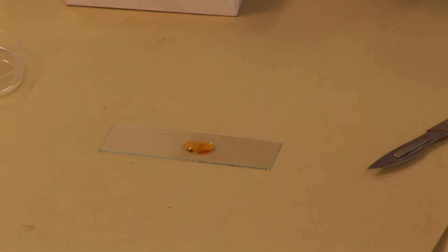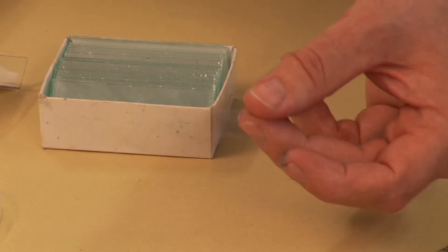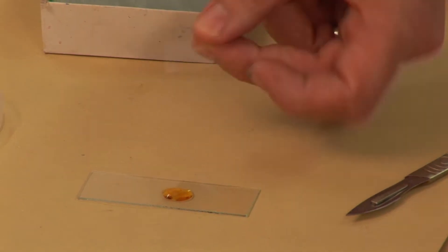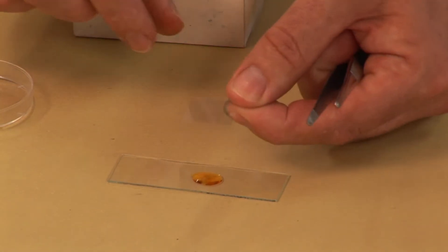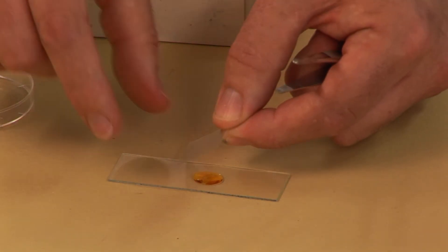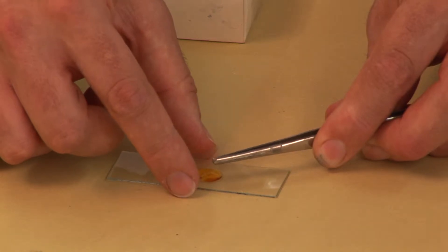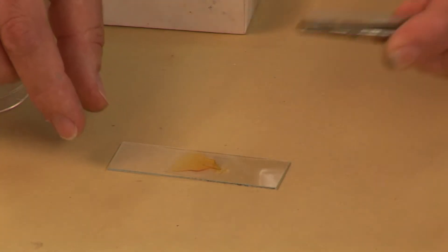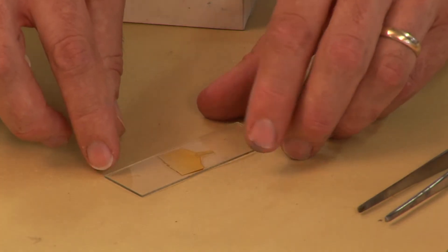Then we need to use a cover slip. Cover slips are very, very thin — you can hardly see them — so you need to be very careful when using them as they can smash quite easily. Take the tweezers and rather than just plonking it on top, which gives you lots of air bubbles, you've got to very carefully lower the cover slip down using the tweezers, like so. There we go — it should look something like that.